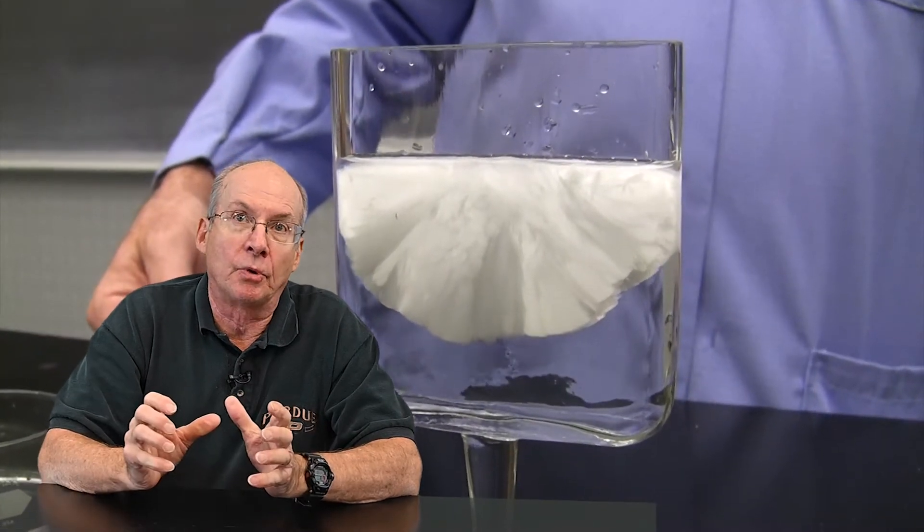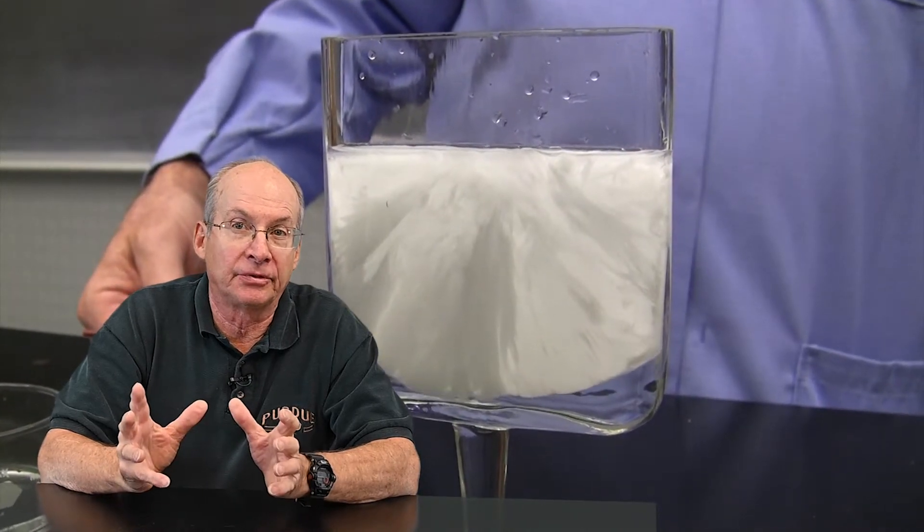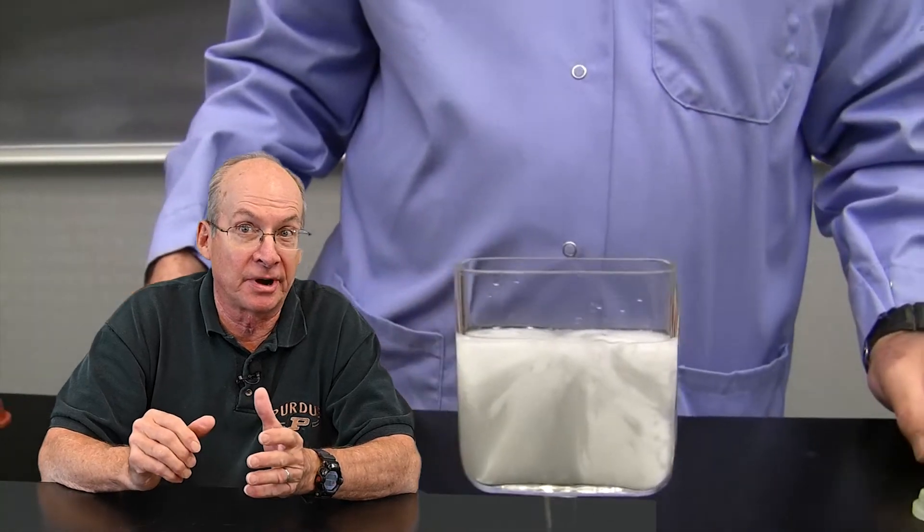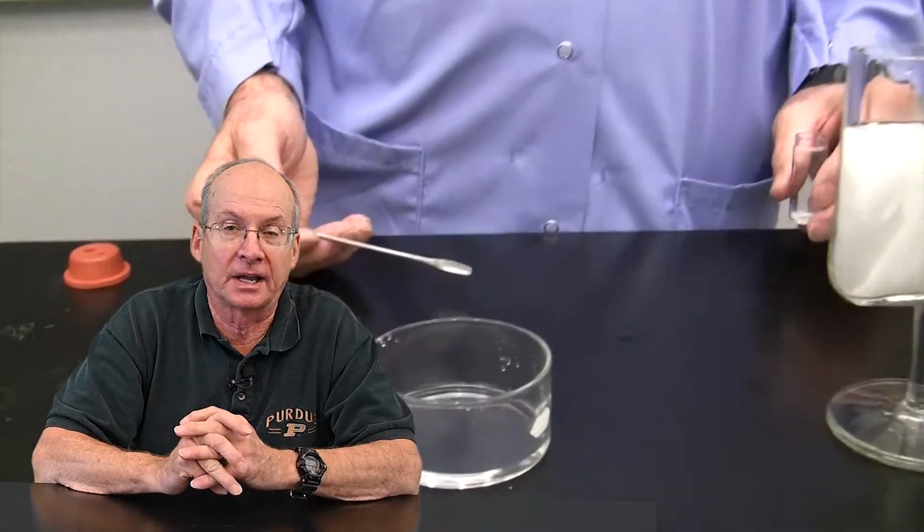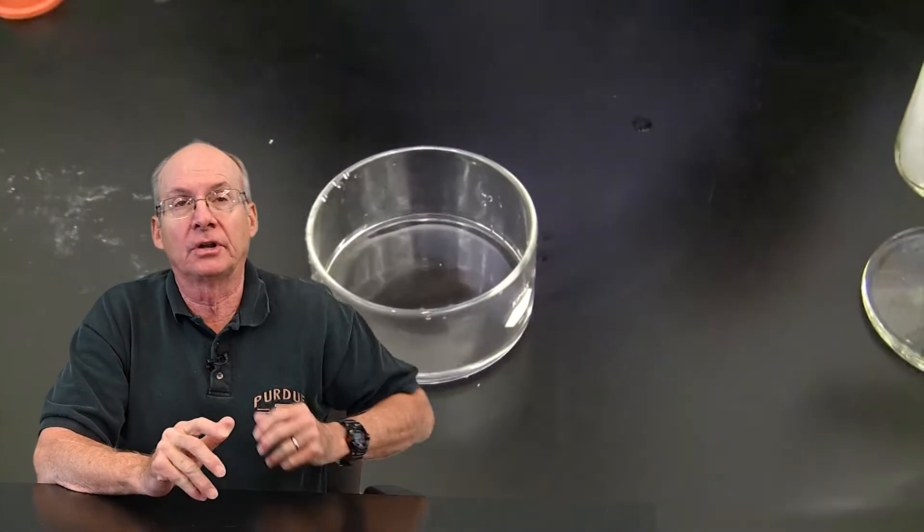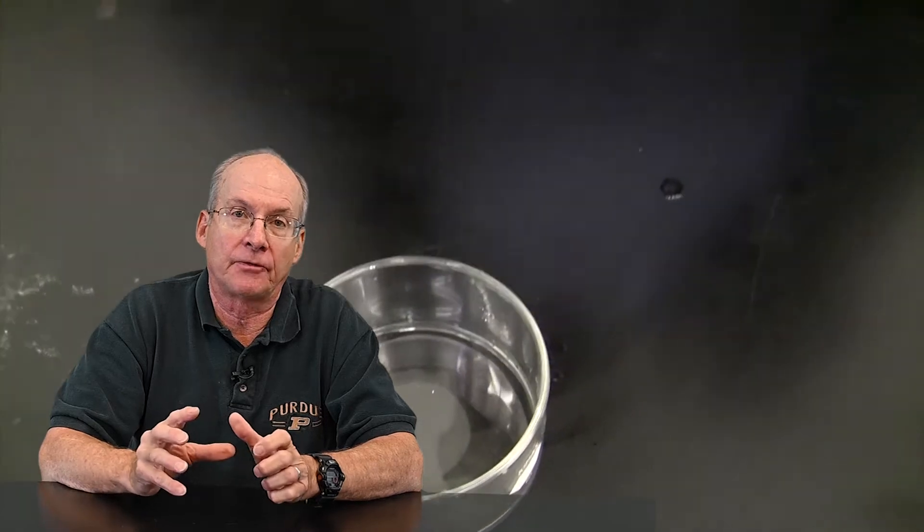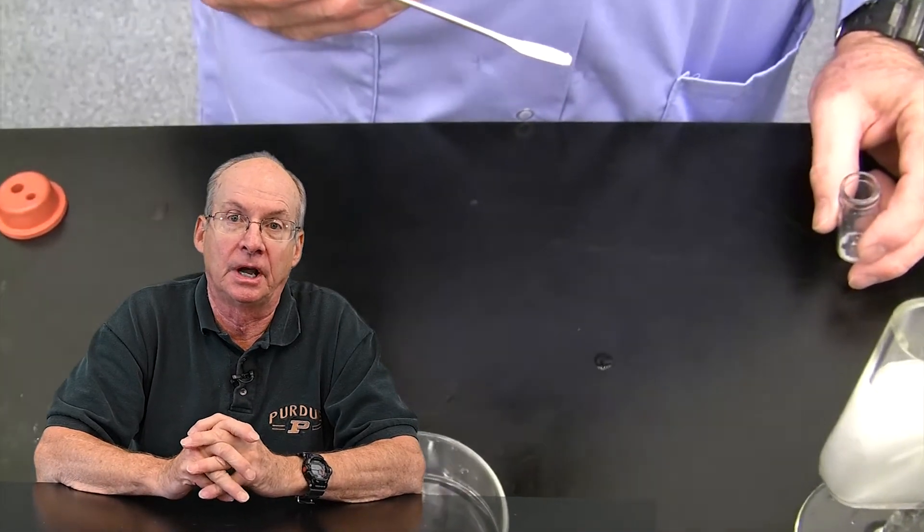So we pour that in there just before lecture, then seal it up. And the other thing is, because you just never know what's still hanging in there, we don't shake it around a lot because a little bit of shaking, something falls back in there, it seeds that way. Generally we've had real good success with keeping things clean, being careful when we pour, and then setting it there and not messing with it any further.